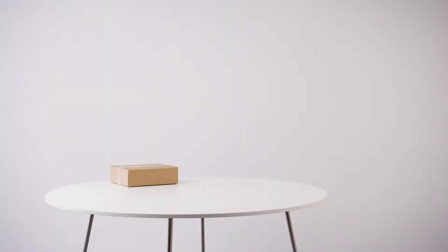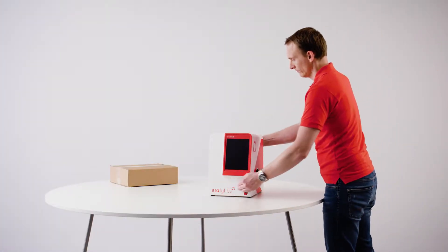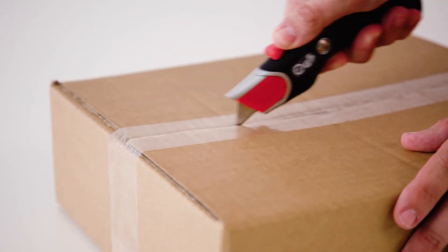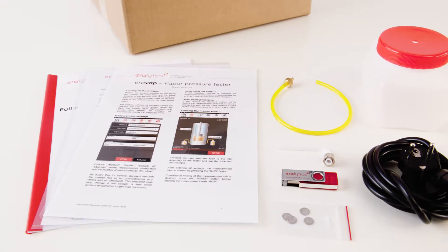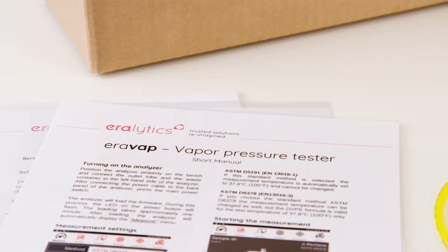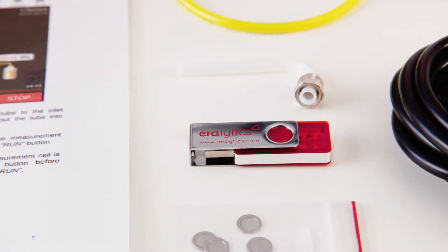Installation. Place the instrument on a stable benchtop. Open the accessory box — it contains instrument-specific items, the printed short manual, and the USB drive with the full user manual.